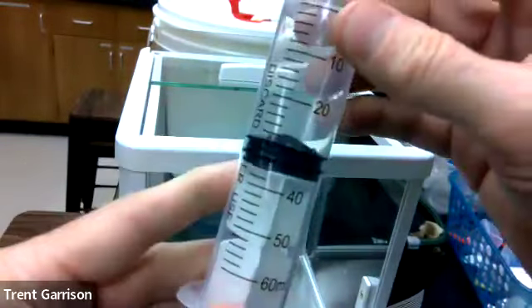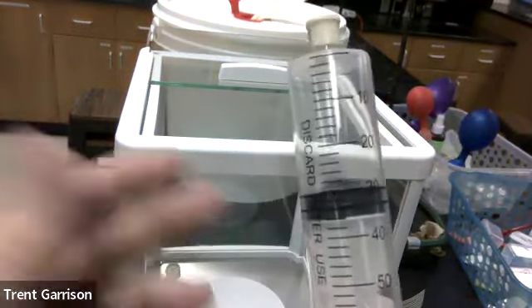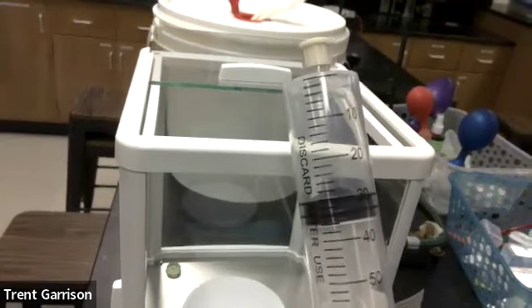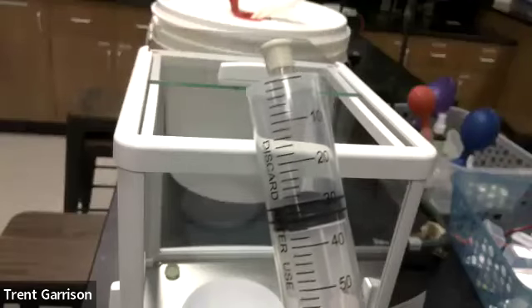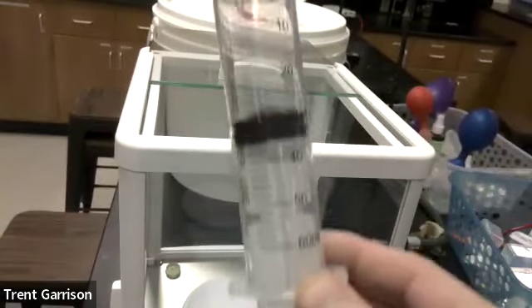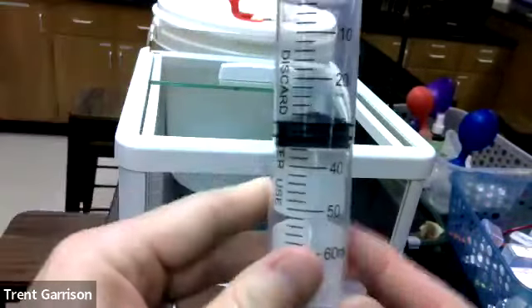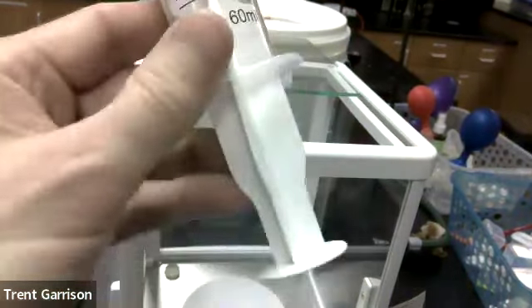Now, what is it sucking up in there? It's sucking up mostly nitrogen air. Now, if you wanted to, you could blow in there carbon dioxide, but mostly what we've got is nitrogen. It's 80% nitrogen. Carbon dioxide would be even heavier, so we probably don't want to even put our mouth on the syringe. Nitrogen is going to be a little bit lighter. And if some of you want to do the math to figure out 18% oxygen, 80% nitrogen, we could do that.